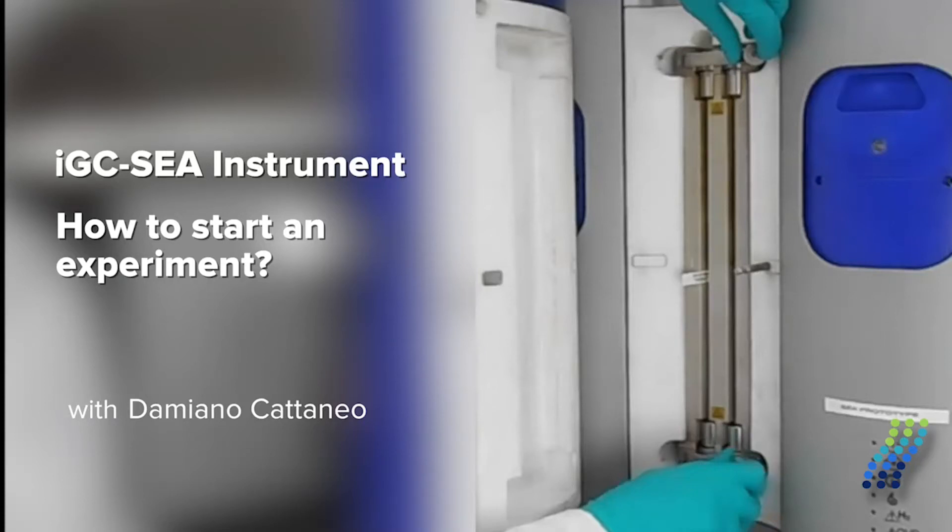Hi, my name is Damiano Cattaneo and today I would like to show you how to set up a simple experiment with the IGC-SEA instrument with the help of the product manager for IGC-SEA, Annette Kander.